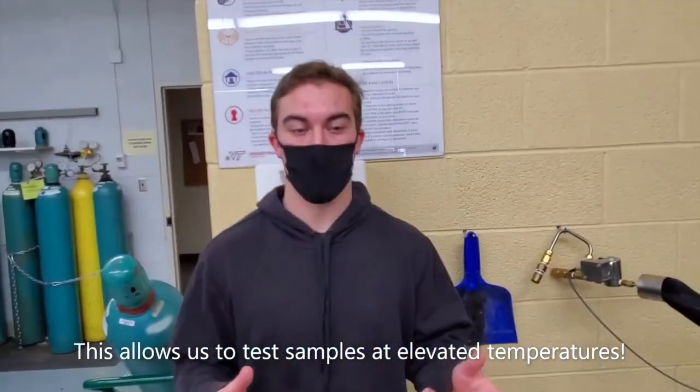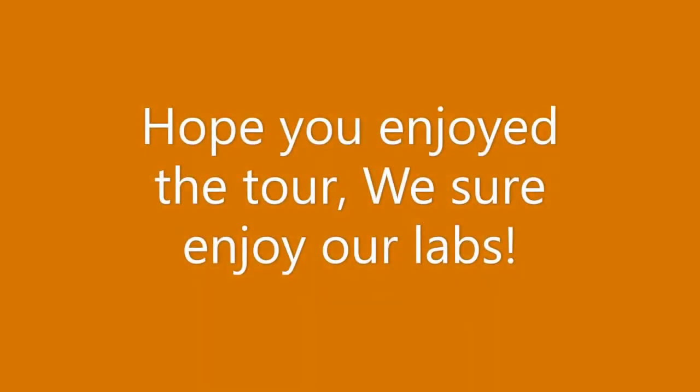And that's kind of all we have in the lab. Have some air, liquid nitrogen, and a few other things. Alrighty, everybody. So, what questions do you have?